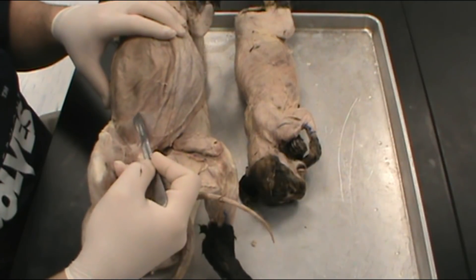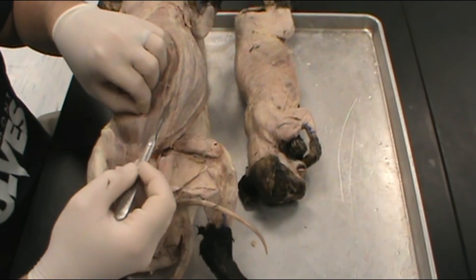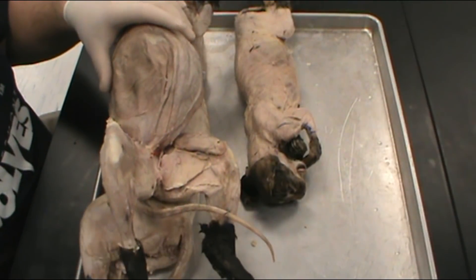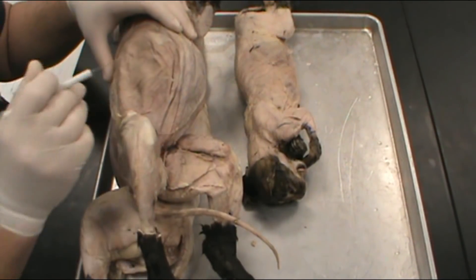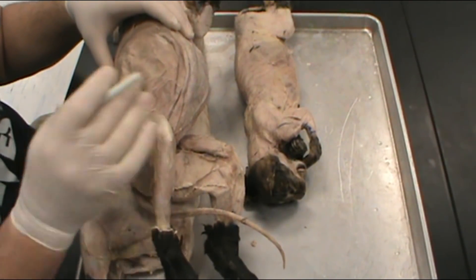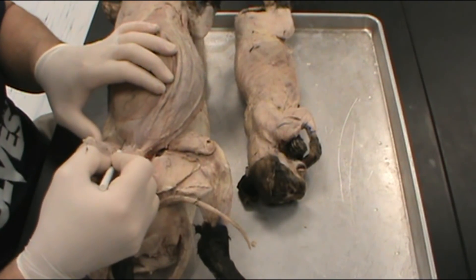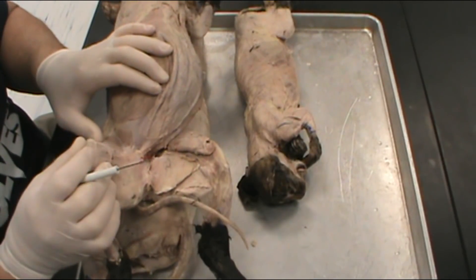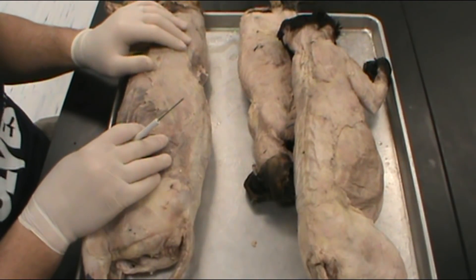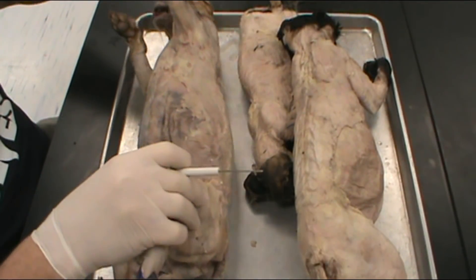If given more time, I can trim and peel the external oblique away to expose another layer of the abdominal wall, revealing the transverse abdominis. You can tell when you look at the external oblique that the muscle fibers run at an angle — they're oblique, and they're on the outside, so it's the external oblique. Down here, the muscle fibers run straight across, so that is the transverse abdominis. That should cover all of the muscles of the upper body and torso.